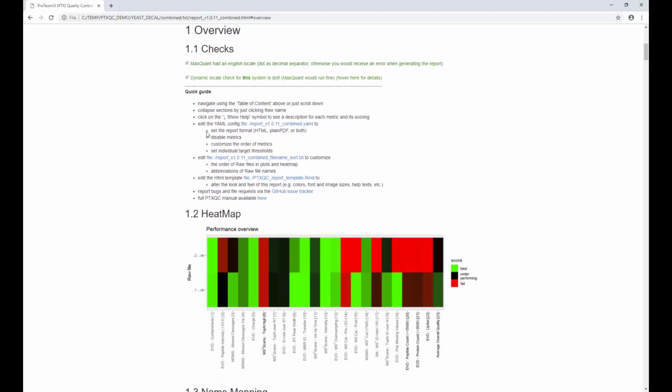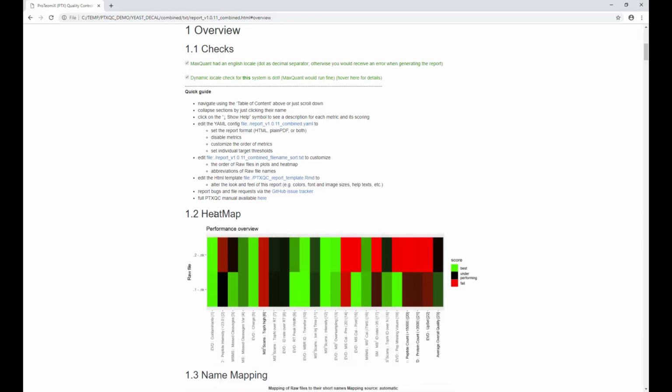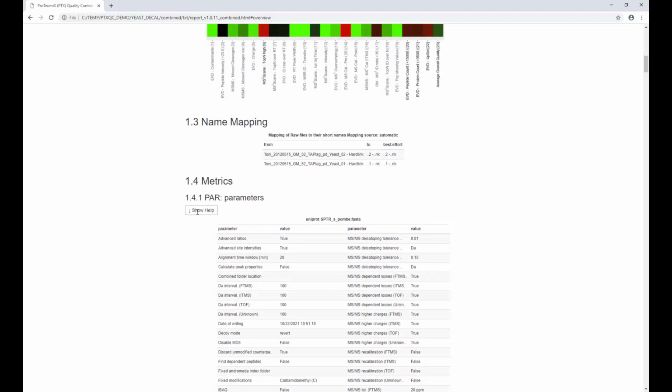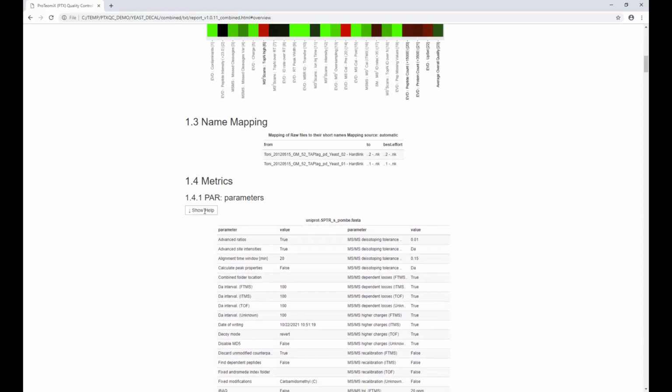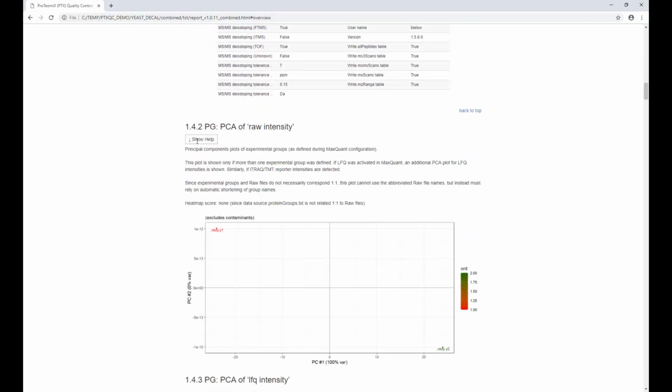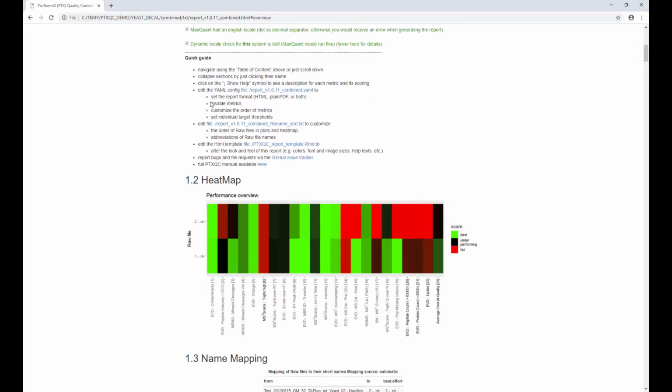So next up we have a quick guide, which we're just going to briefly go over. You can collapse sections by clicking the name, okay, if you want to get rid of it. Then, very important, each metric, which are down below, has a show help button, so you can basically read on what the metric is trying to tell you. And this is available for all the metrics, so you can quickly read up on what you're supposed to see and how to interpret this. It will also tell you how it scores this metric and how that's done. And we'll come back to that in a second. Okay, so that's available.